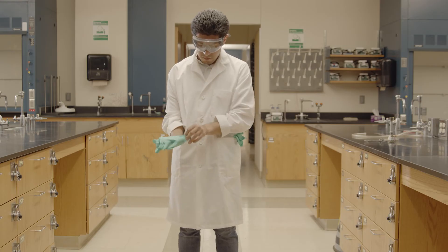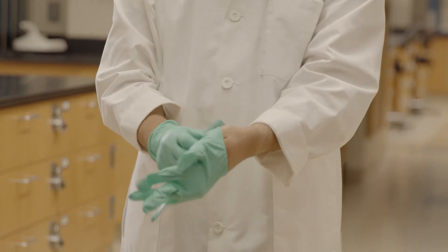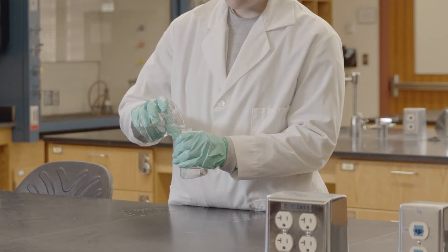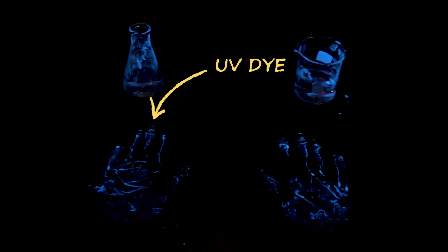Skin exposure is always possible when handling chemicals, and gloves are the best way to prevent this. Lab gloves should be considered one-time-use disposable gloves. You should select a material that is resistant to whatever chemical you're using — there are easy-to-find resources online that describe how various glove materials protect against chemicals. Remember that chemicals can be transferred from your gloves to any item you touch — a calculator, computer, or cell phone. Chemicals can also be transferred to your pen and into the body if you place it in your mouth. This kind of chemical transfer is why food and drinks aren't allowed in the lab.